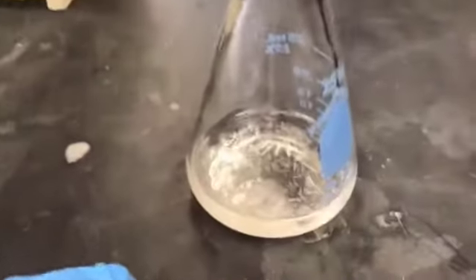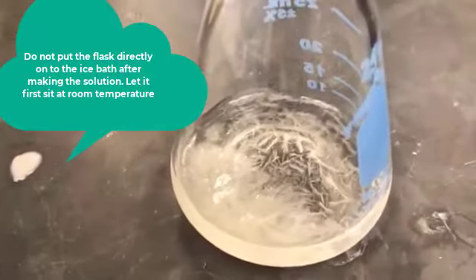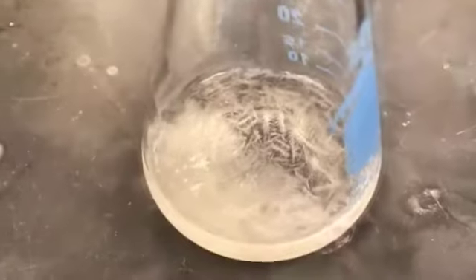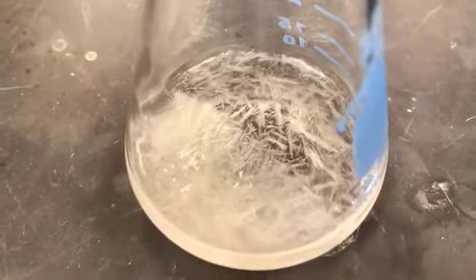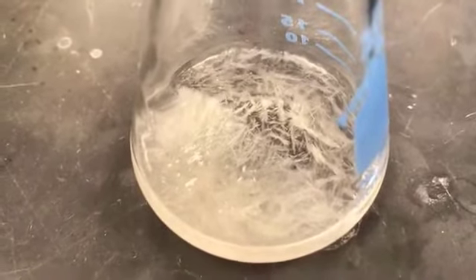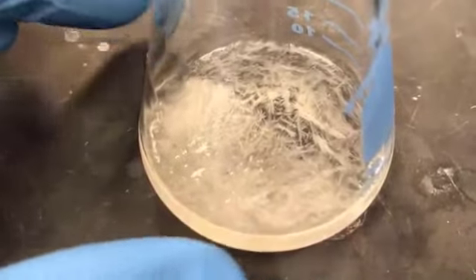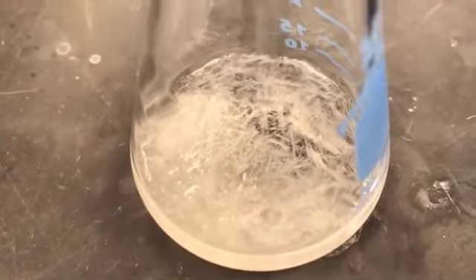As you can see, the crystallization has started now here. It's at room temperature, so beautiful crystals of sulfanilamide are forming. It hasn't come to room temperature yet, it's still warm, but you can see the sulfanilamide is beautifully crystallizing out.